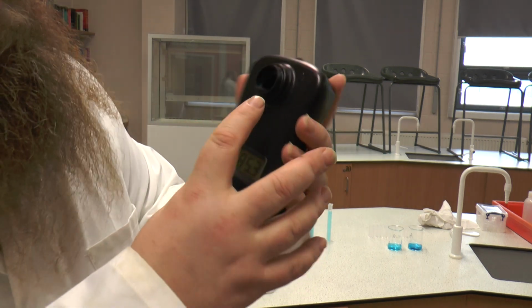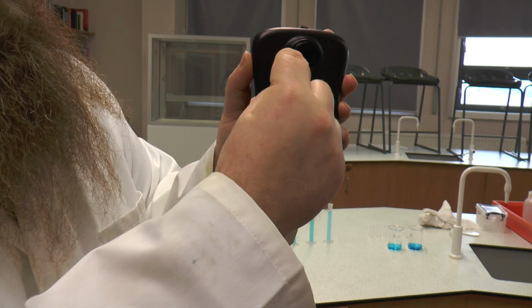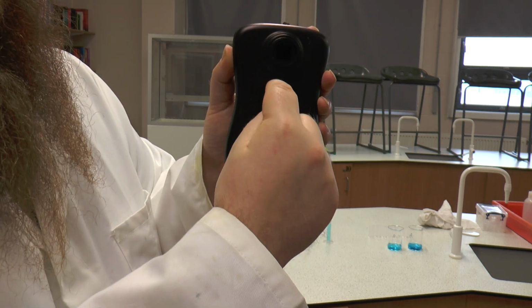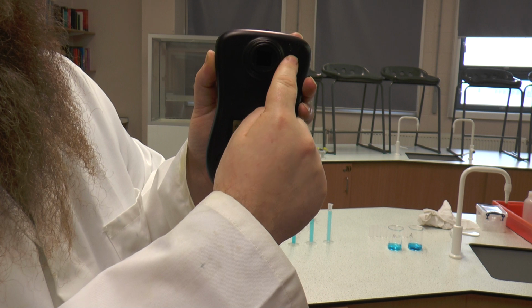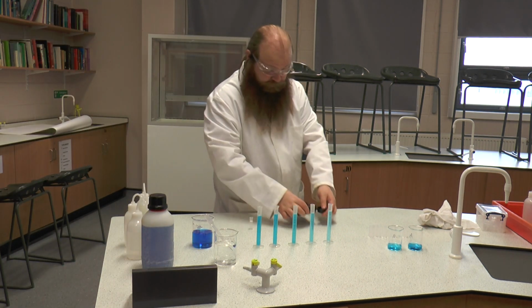Now, if you look at the hole that we're going to slide it into in our colorimeter, there is a little light that flashes on one side, showing that the light is measured from this side through to this side, across. Okay, not up and down. So the clear sides of the cuvette need to be here and here. If they're the other way round, you will get very wonky readings.